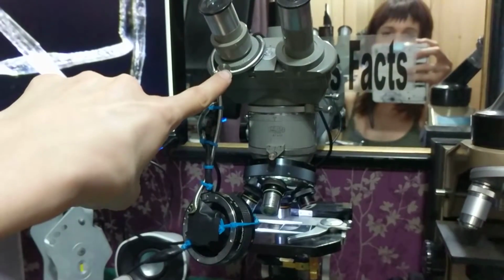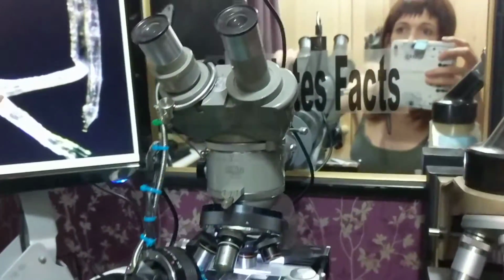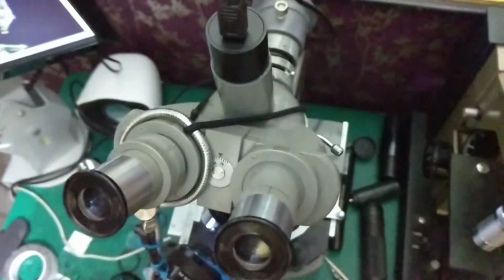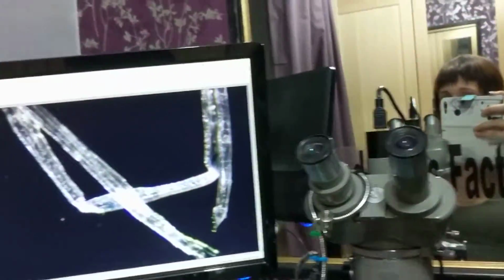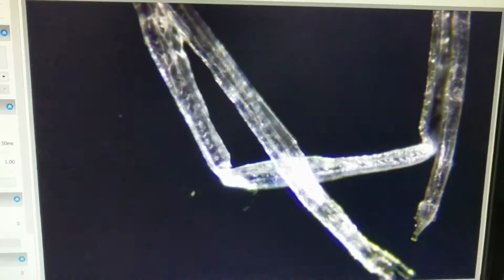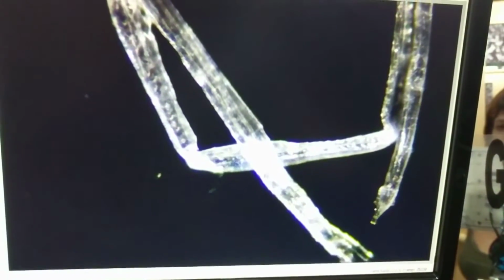And then I've hooked the holder around the eyepiece, and then there is a hairband holding onto the unit, which may snap at any moment, but it should be fine. And this is the result so far, which isn't too bad. This is just a bit of fluff from a tissue. Let me see if I can focus it any better. Well, it's not too bad anyway.